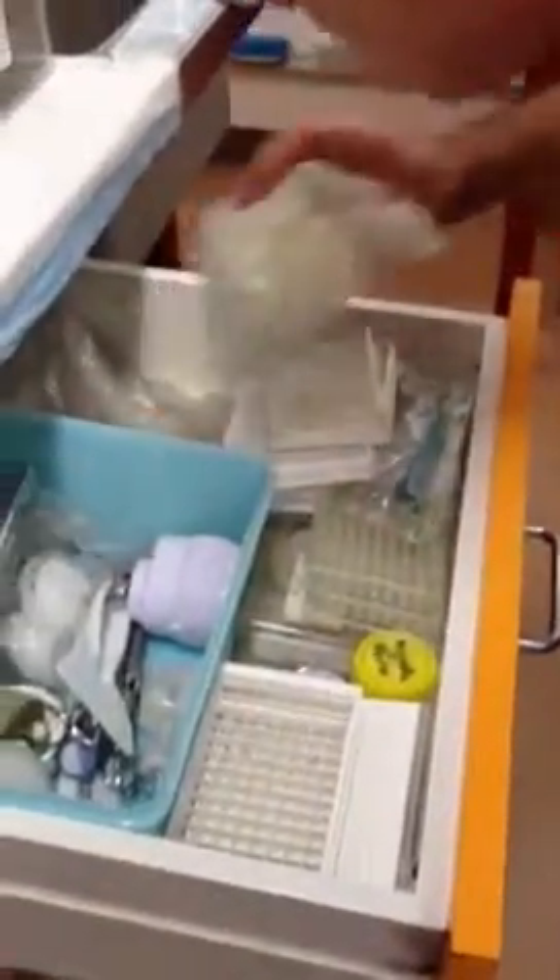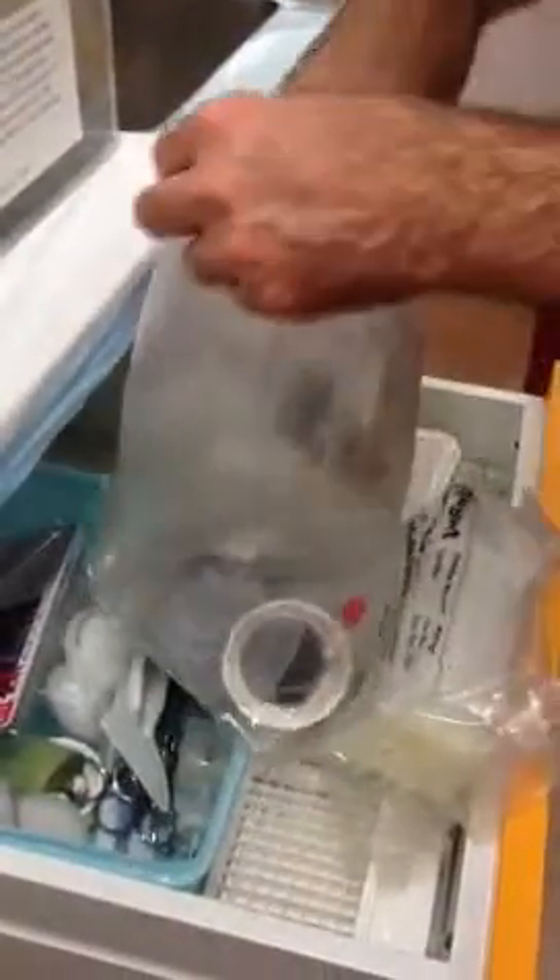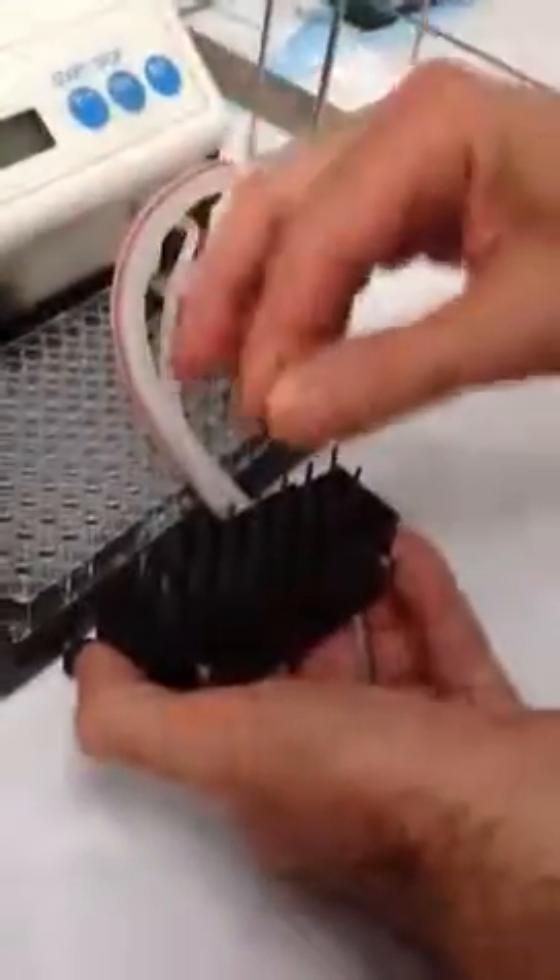What we use for a tool is an old one — there's a spare one somewhere. So I'm just cleaning up the set here. So one of these — I've got some, I can let you have this one. Basically all you need to do if it's blocked up is just put that in there and do that.